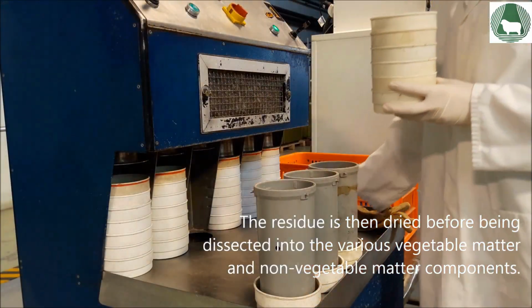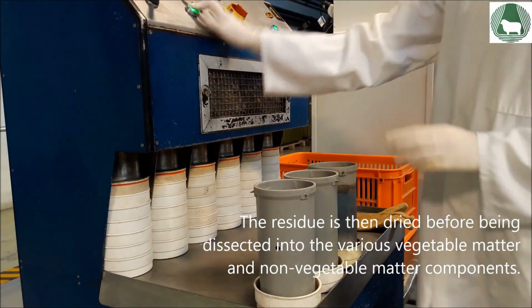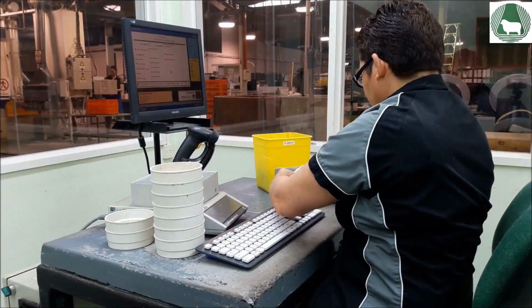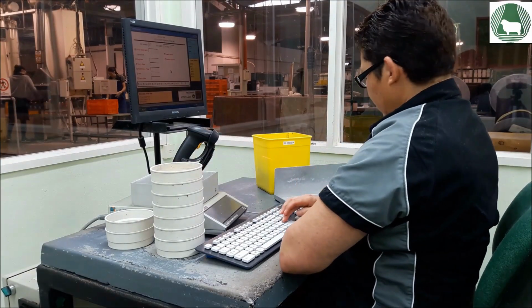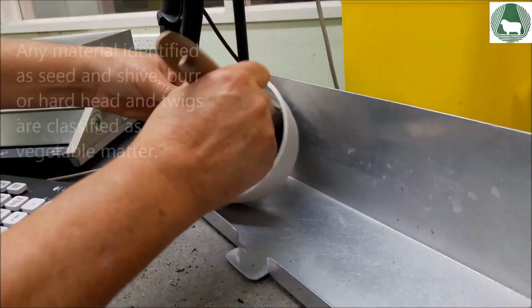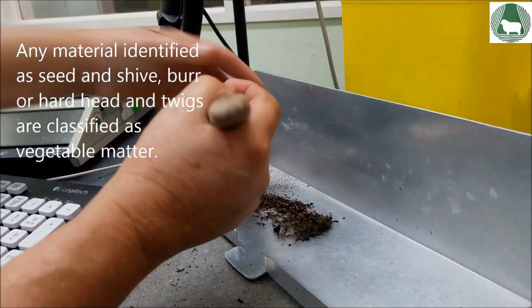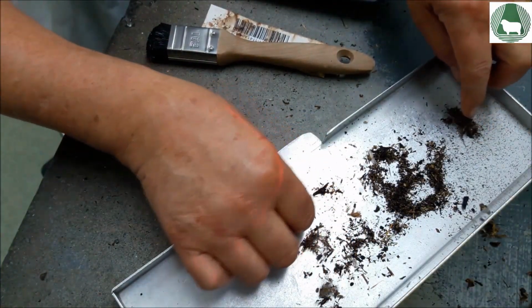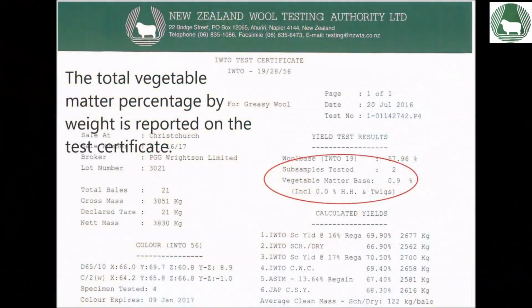The residue is then dried before being dissected into the various vegetable matter and non-vegetable matter components. Any material identified as seed and shive, burr or hardhead and twigs are classified as vegetable matter. The total vegetable matter percentage by weight is reported on the test certificate.